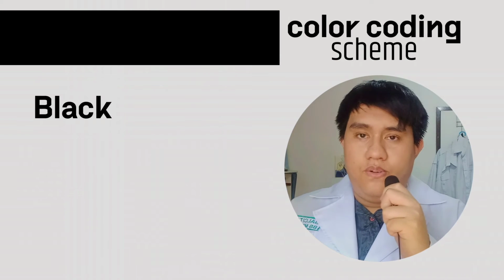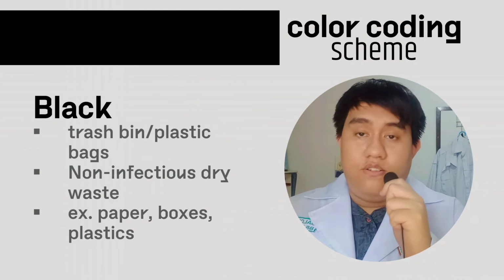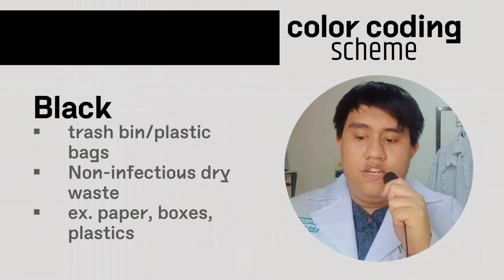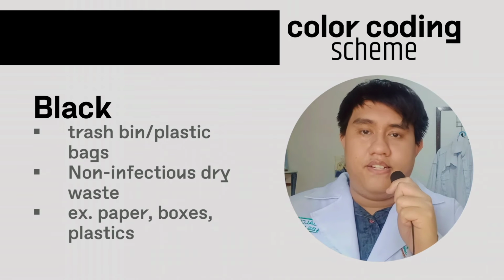The first color coding scheme we have is the black. Black bag represents general waste. It has a trash bin plastic bags type of container, and it has a non-infectious dry waste. Examples for this are paper, boxes, plastics, and the like.